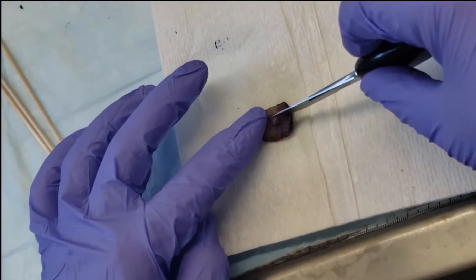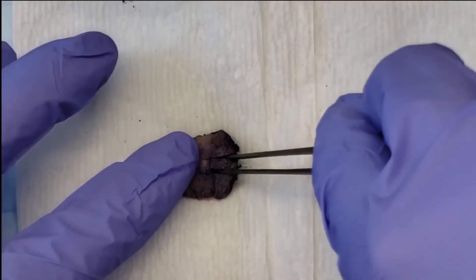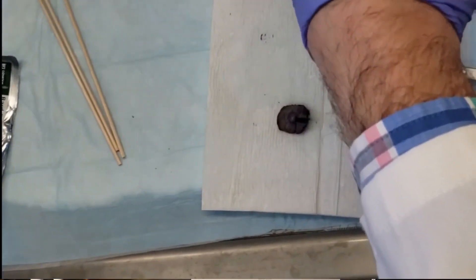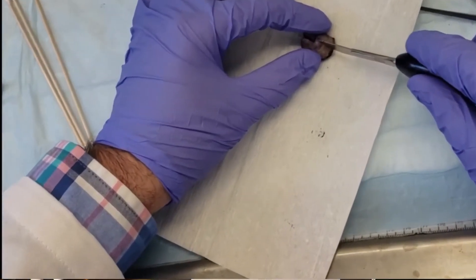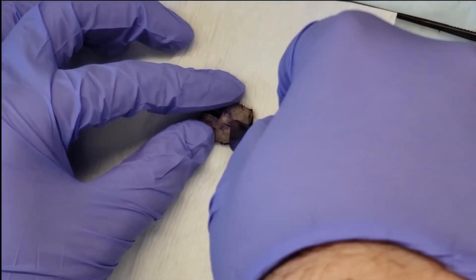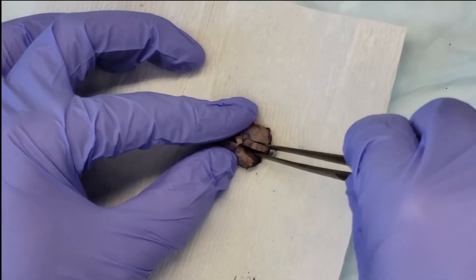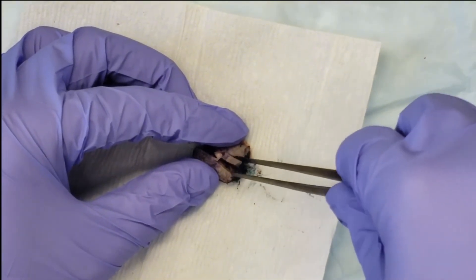We flip the specimen over so that we can see the cancer and then we want to make perpendicular sections on two of the ends. Perpendicular sections are sections that include the margin and the cancer — this way we can measure the distance of the cancer to that specific margin. We took it from one side and then we're going to take it from the opposite side to figure out the closest margin under the microscope and measure it. We eyeball this — on a small specimen it's a little easier, but on a larger specimen we go where we think it is closest or take a few perpendicular sections from the margin to the malignancy. So we have our margin in two directions from the cancer to the closest margin.